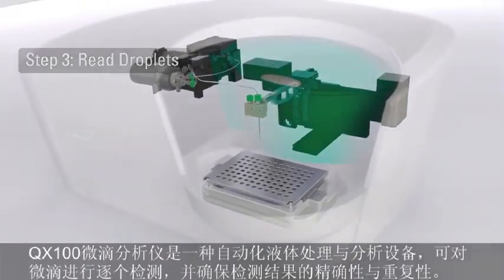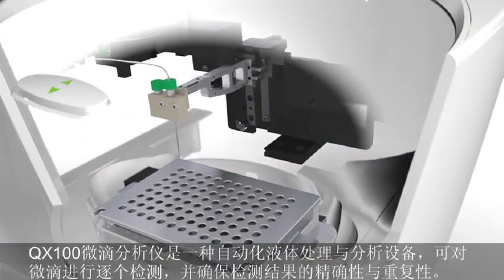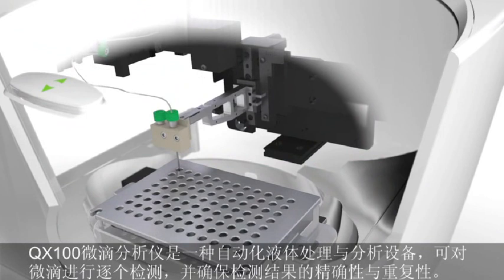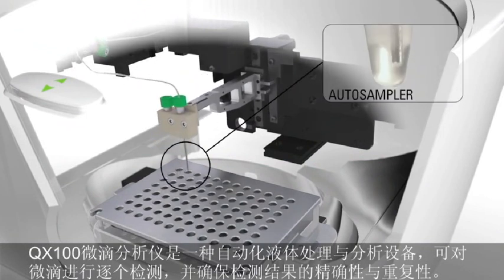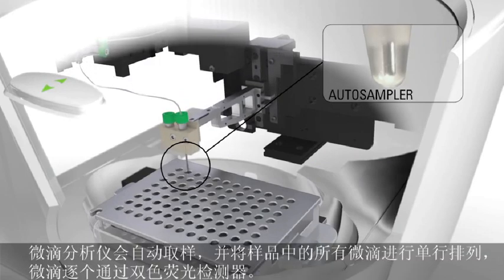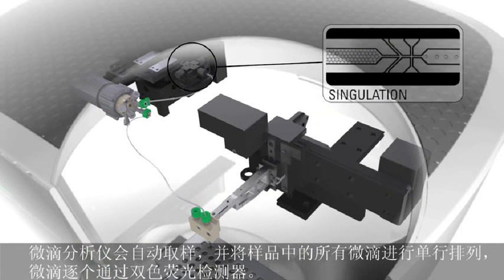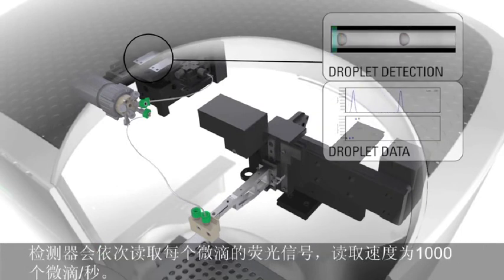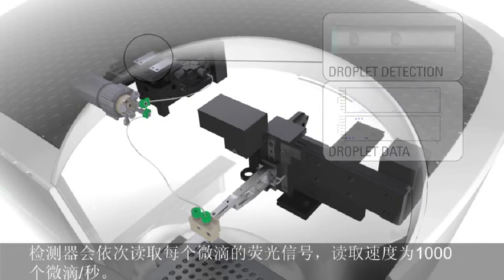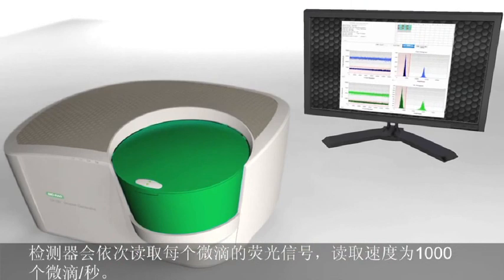The QX100 droplet reader is an automated liquid handling device equipped with optimized microfluidics designed for precise, reproducible detection of target DNA sequences, droplet by droplet. The droplet reader automatically sips each sample, singulates all the droplets from a sample, and then streams them in single file past a 2-color fluorescence detector. The detector reads each droplet in turn at the rate of 1,000 droplets per second and determines which droplets emit fluorescence and which do not.